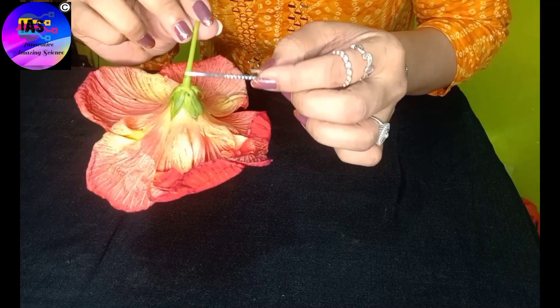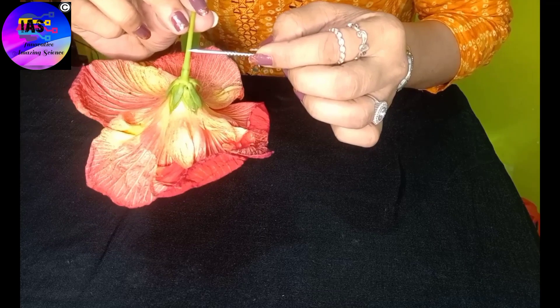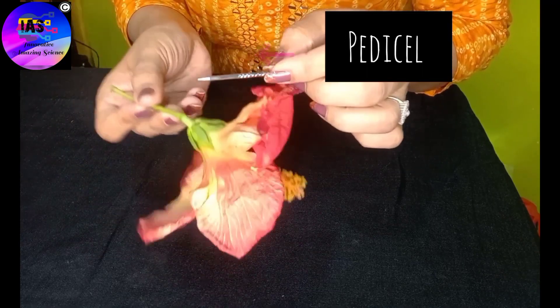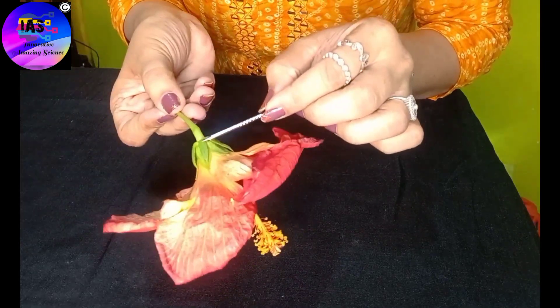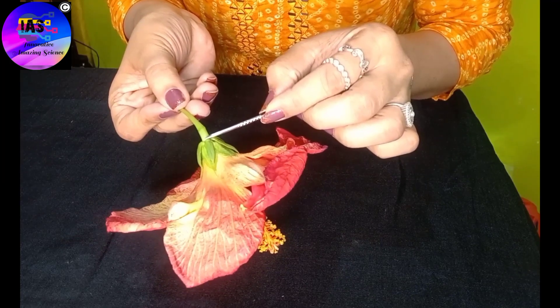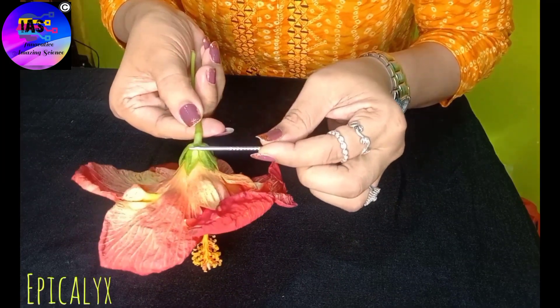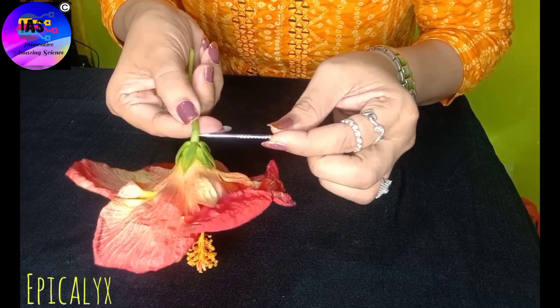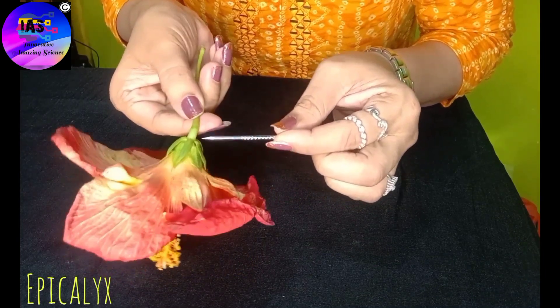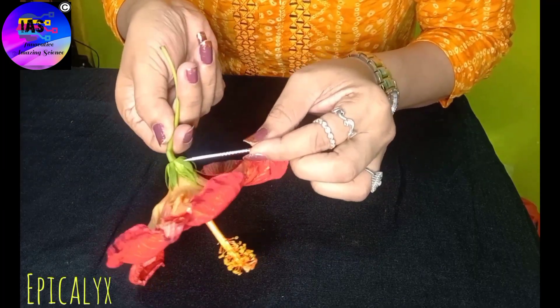You can see the stalk of the flower, which is called the pedicel. Hibiscus is a pedicellate flower, so this stalk supports the entire flower. Next to the pedicel, you can see the epicalyx. The epicalyx is found in the Malvaceae family and is the additional whorl around the calyx of a flower.